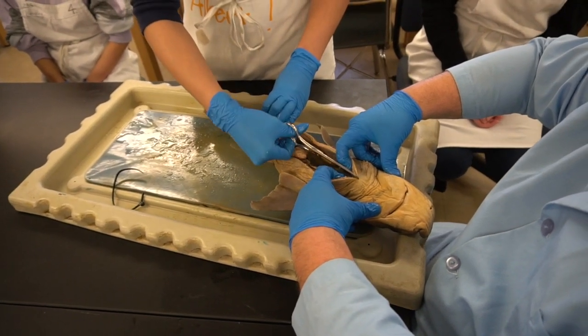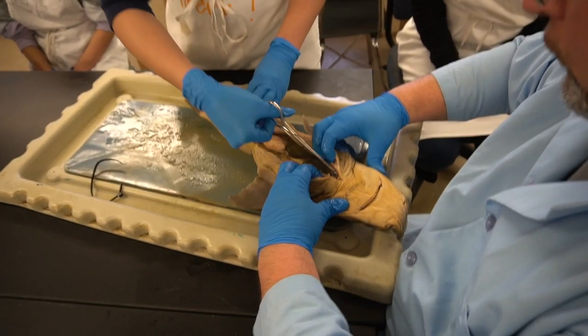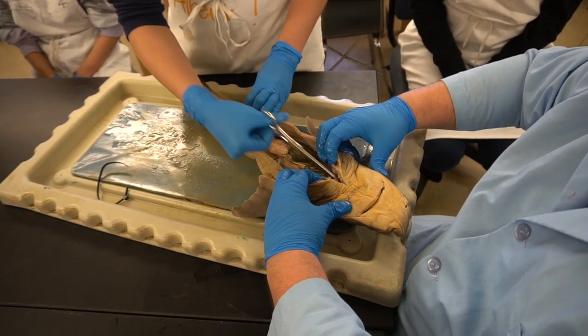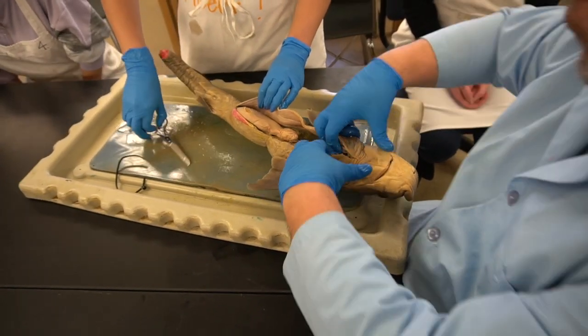Just snip. Now see if you can get down. Now you're cutting just through. You cut over it. Now you should be able to expose a little bit more. Cut through. There you go. Wow. See, as soon as with my pressure and that snip, it opened up very easily. If you do it by yourself, you're going to struggle to get through it. So use a little bit of pressure, a little bit of force to do that.